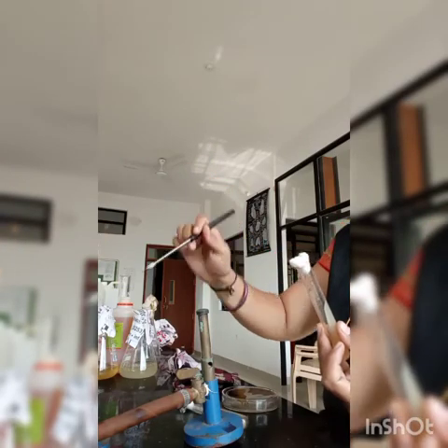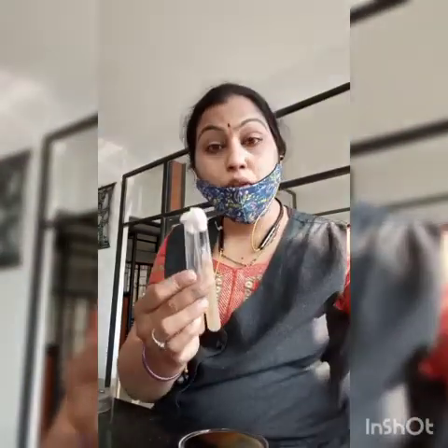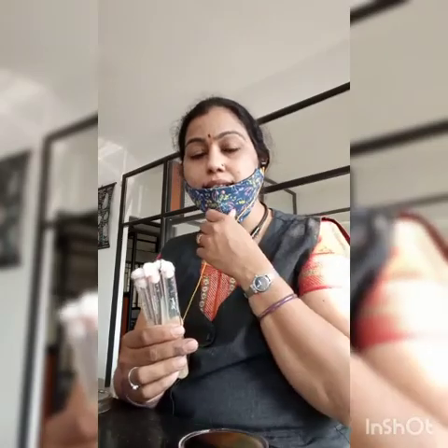So all the slants are ready and I will incubate it, and after the incubation period I will show you results. Okay, this is the subculture method.